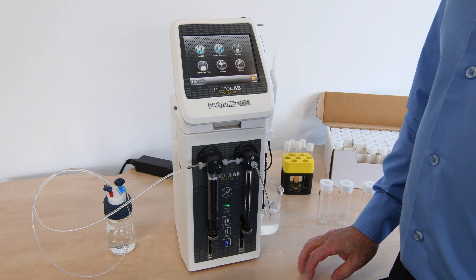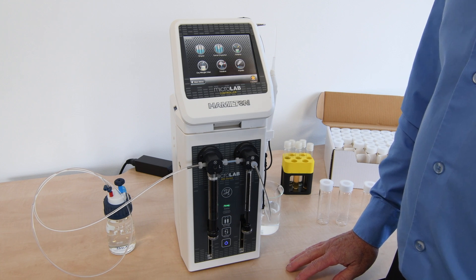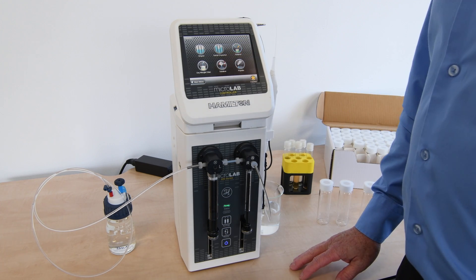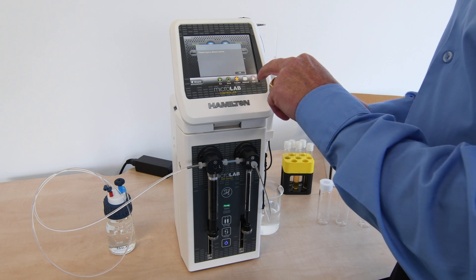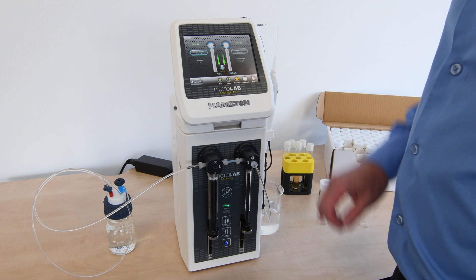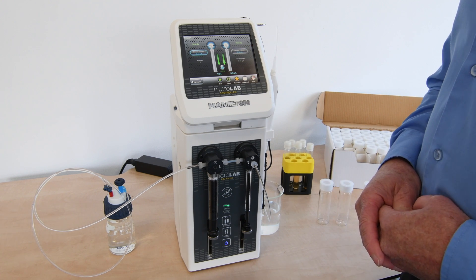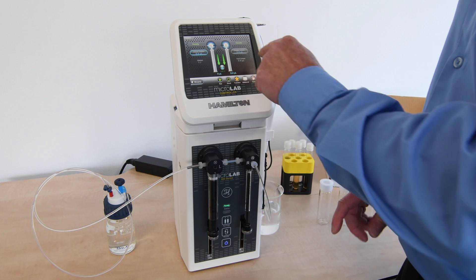Here we're going to look at some of the advanced features of the dilution wizard, including the standard setup. If we go to dilution, it initially asks us to put the diluent volume in, because in default form it was showing the diluent volume and the sample volume, so the user can determine the sample size and diluent volume they wish to make.